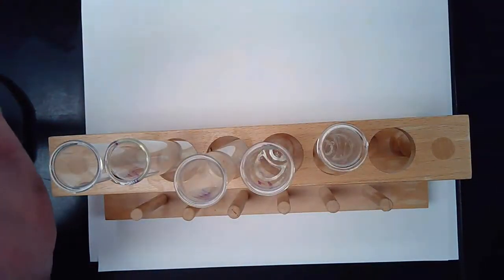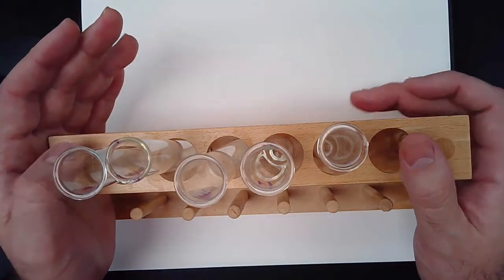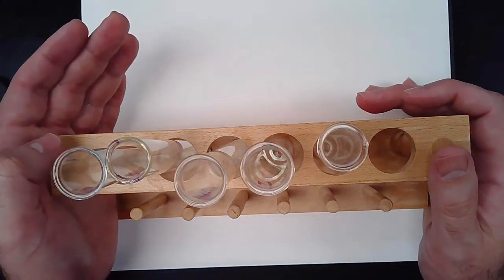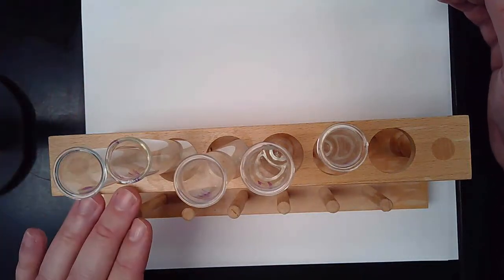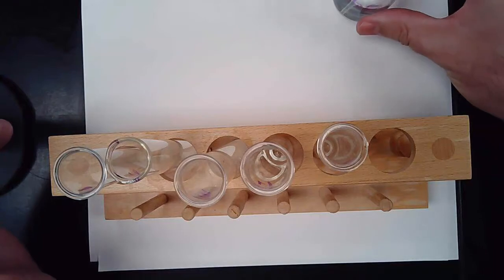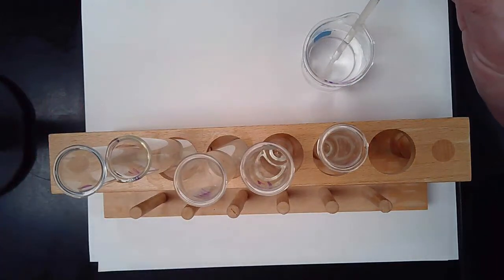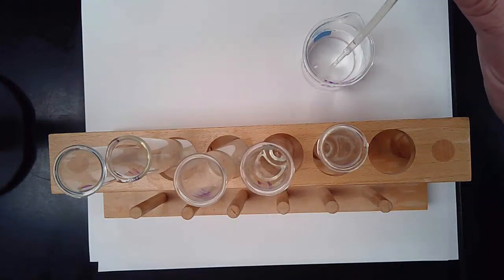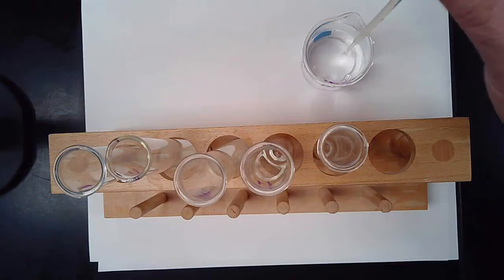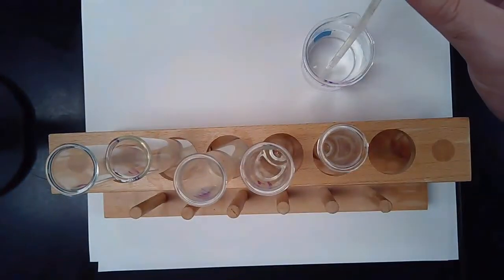The next thing I'm going to do is add our additives. Again, you should be following along in your lab, and if you're looking at the table on the third page, we're about to start adding what it says. Test tube number 1 now has milk, so I'm going to add to that about 1 squirt of this water. These are approximately 1 milliliter pipettes, but I'm going a little higher, so they'll probably get about 2 milliliters of fluid. So I'm going to add 1 squirt of water to test tube 1.